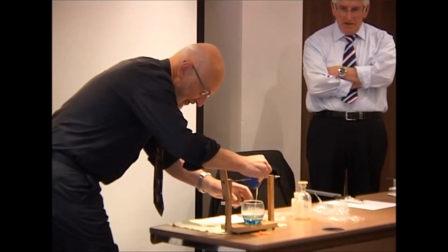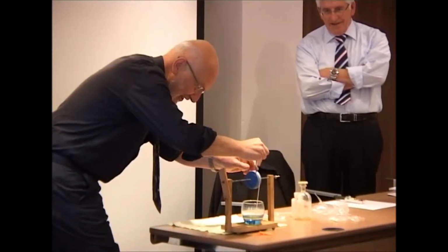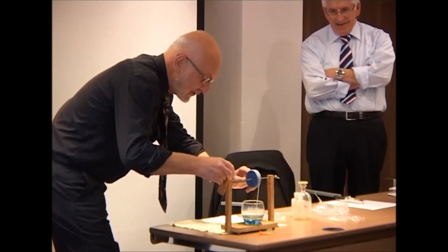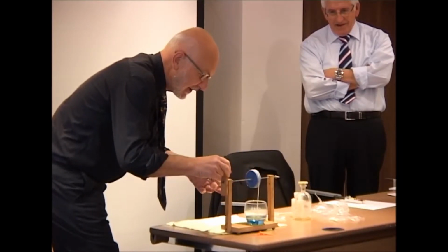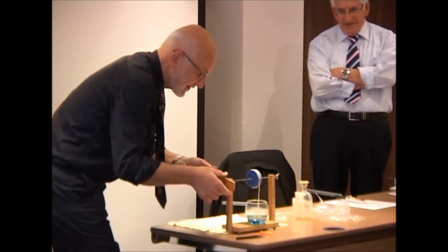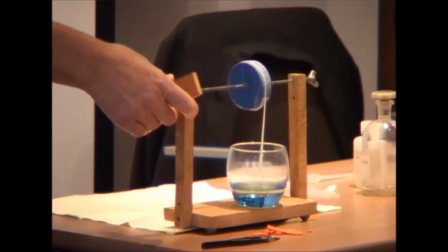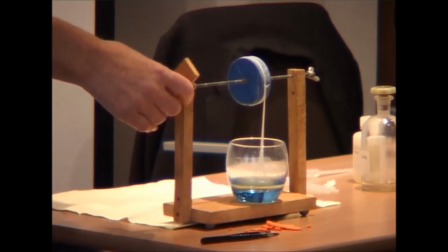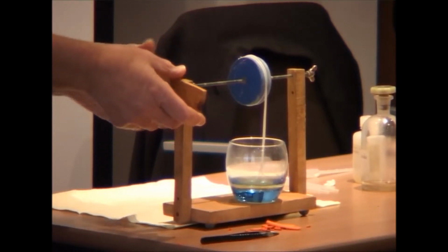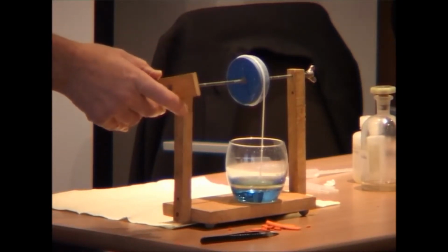So we have formed some polymer, as you can see. Formed something. We need Barry to do an SEC or something on it to try and make sure. And it's formed at the interface. It can only form at the interface because that's the only place where the two liquids come into contact. The two reagents come into contact. Most of the reagent is either in the water or the other half of it is in the hexane, and therefore not in contact with its counterpart. The only contact occurs at the interface. As we pull this polymer out, the interface gets renewed, of course, and more polymer gets formed.